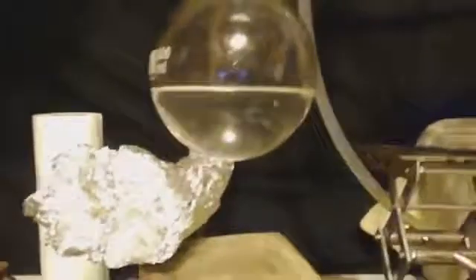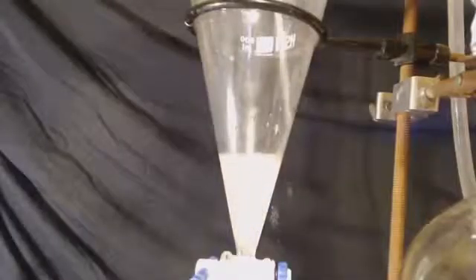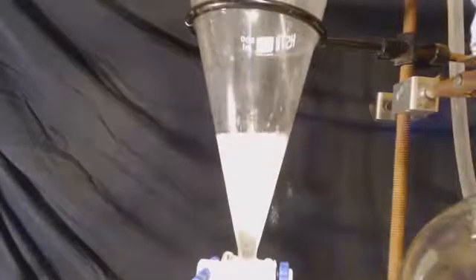Basically, all I'm doing is I'm just distilling that out. It was a pretty good distillation. I didn't go too fast or too slow. There's the drip rate. And like I said, it started out around 38 degrees, I took it all the way up to 78. Now, there's the receiving flask. You can see where the line is, right below the 50 milliliter marking. The bottom part is the ethyl bromide, and the top part is like the ethanol and water and stuff like that. And you can see the pot cleared up. Remember how it was red? Now, there's no more. You know that you used up all the bromide because the coloring is gone.